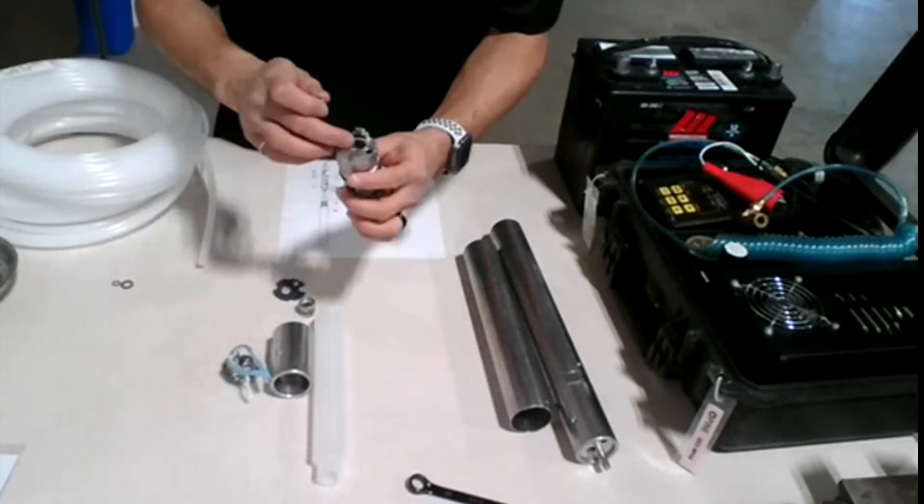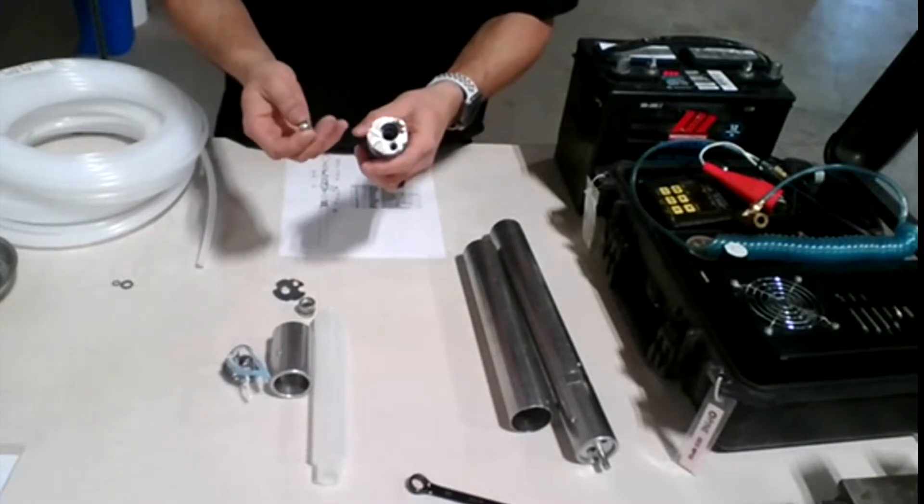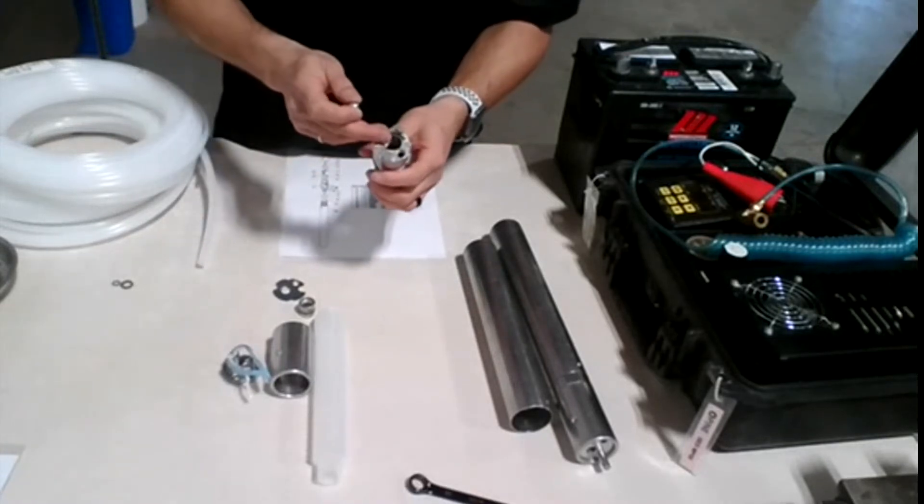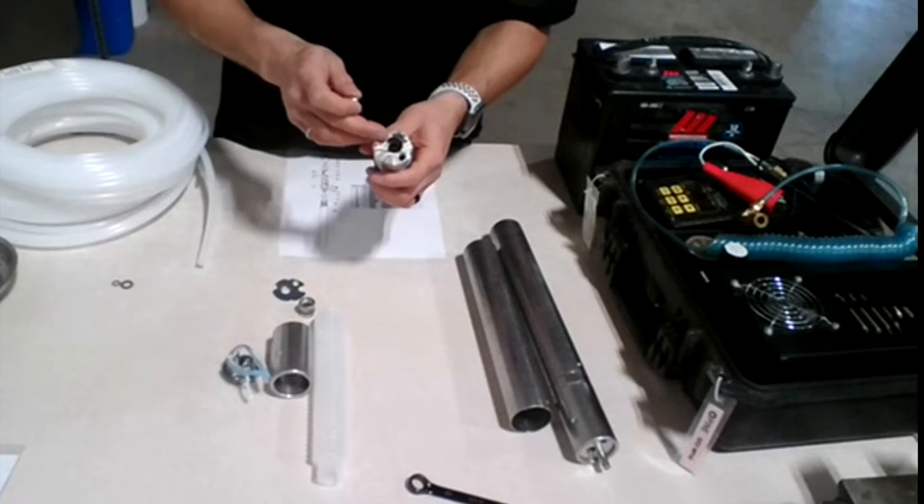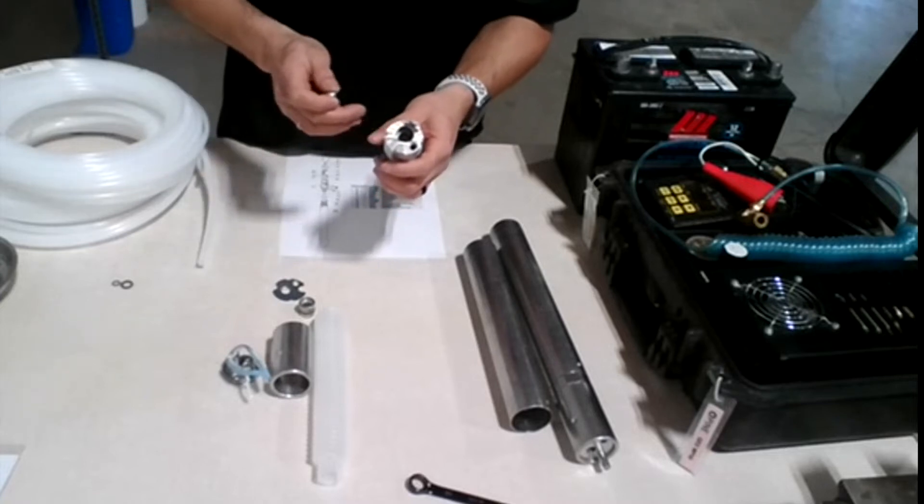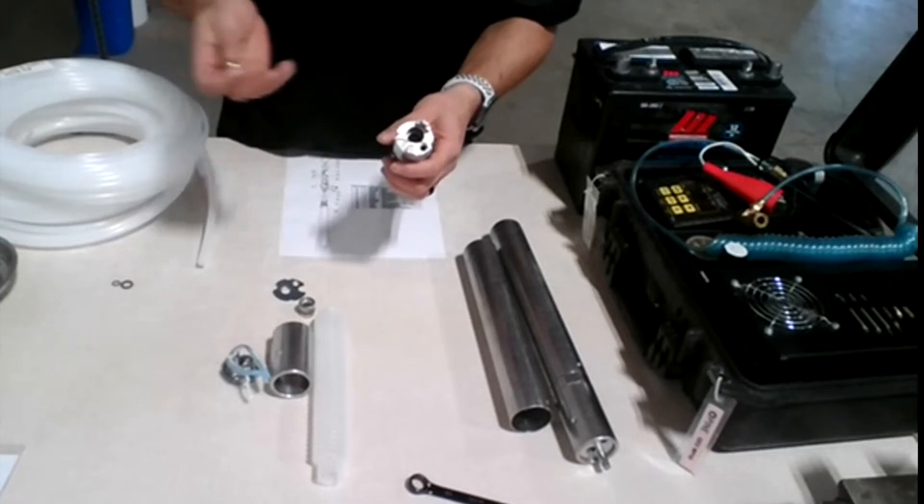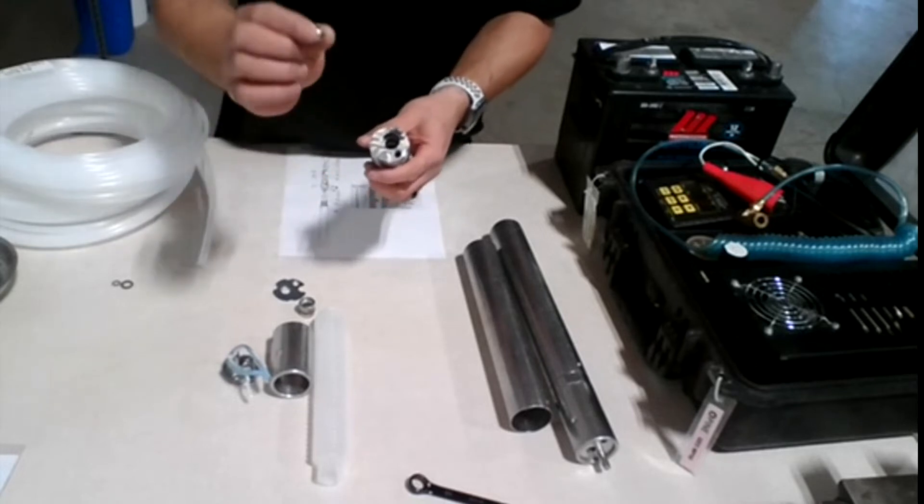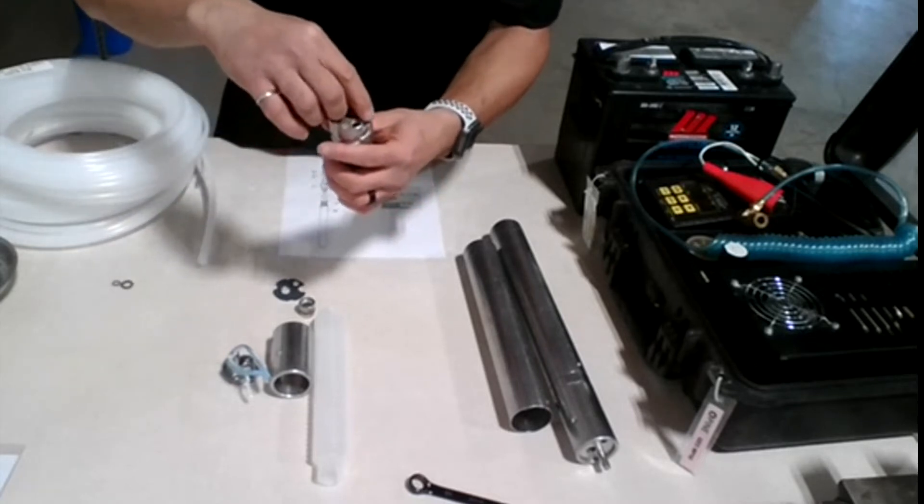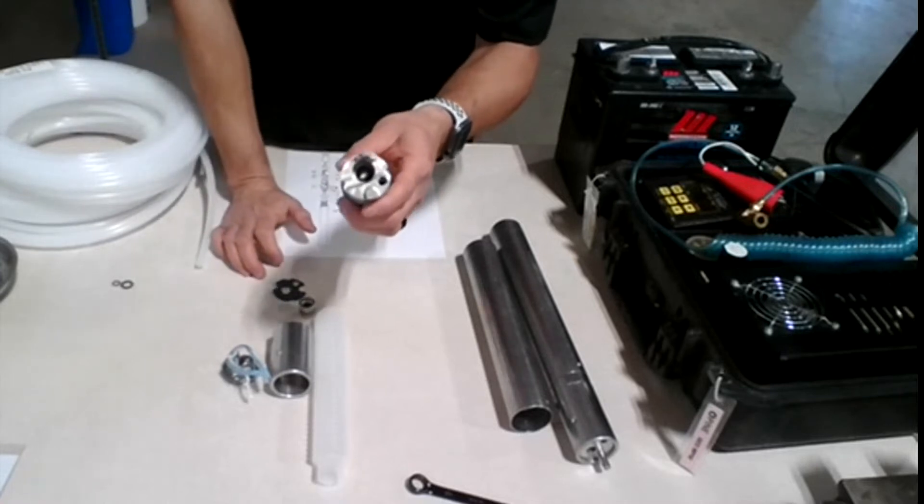Then, for the water part, we also have a check valve. So this actually helps prevent the sample from going back to the pump. It's like a check valve or a one-way valve. We hold the ball valve right here and just drop it in the hole, like so.